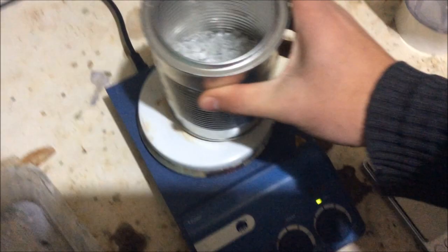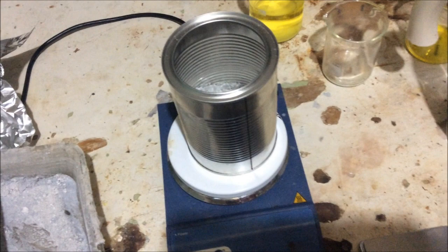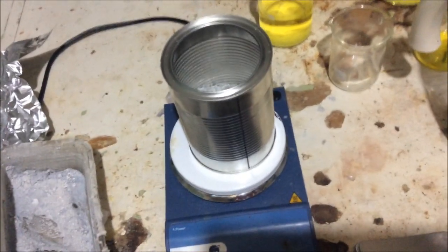This container might get quite etched, but that's okay. We obviously also can't use Teflon stir bars. Concentrated sodium hydroxide at these temperatures also might ruin the Teflon stir bars. So we're going to have to do it without stirring as well.